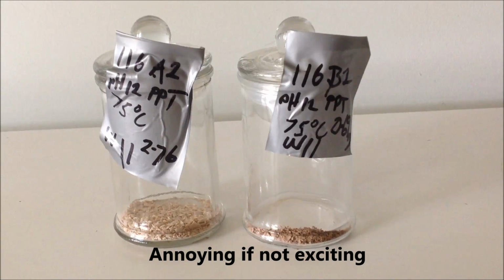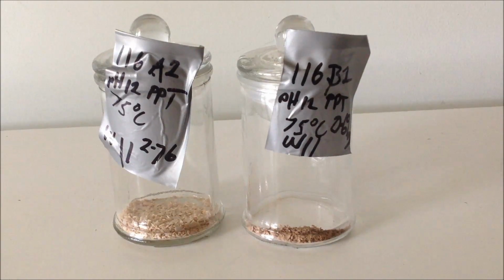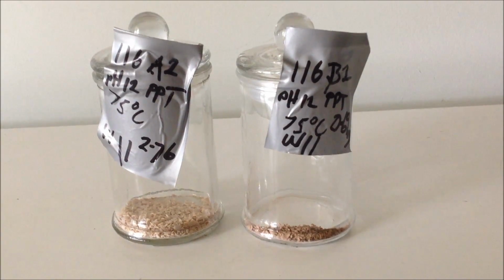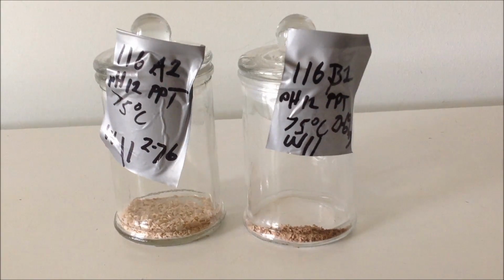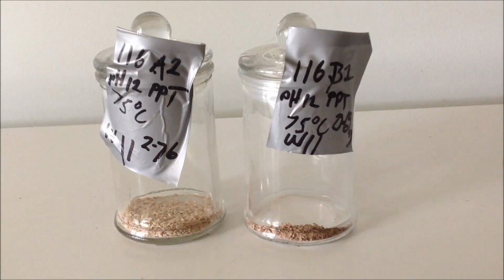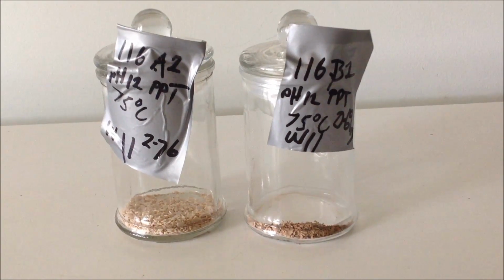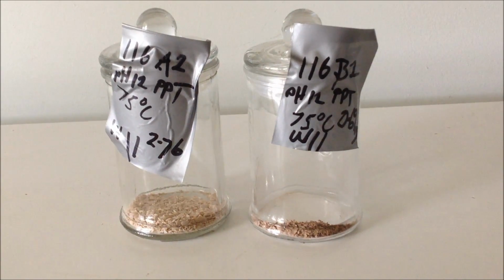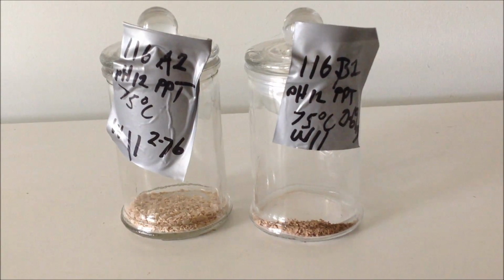Then, as you can see visually with the eye, sample B, which is the second stage precipitate, dried to a significantly less amount. It's only 0.69 grams compared to 2.76 grams for the first stage precipitate. Now, you saw it with your own eyes. They look like a similar amount. You could possibly say that B was a little bit lighter, because remember when we heated it up in water, it was more floaty, but I just wasn't expecting this.